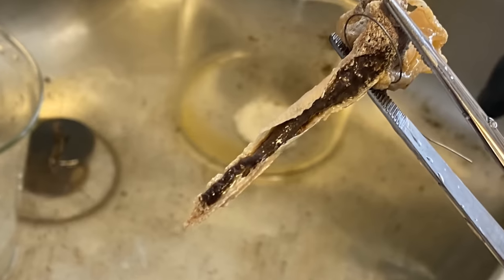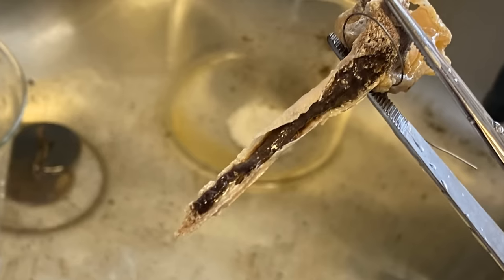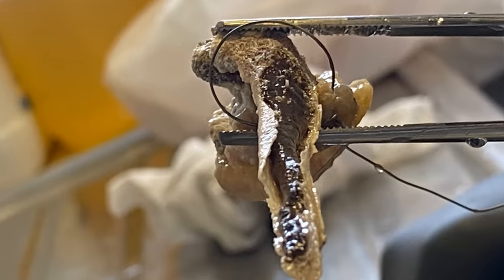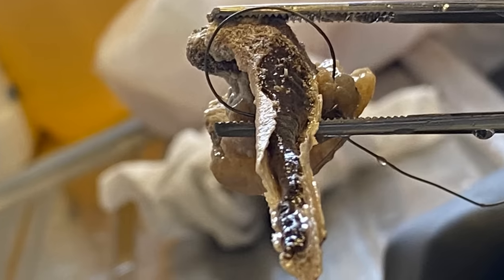And the bone itself started to dissolve. Piranha Solution had behaved almost like a saw — it cut off everything that was submerged. So through the bone, you got a cross-section. You could see the marrow inside. And even the marrow had gone black, presumably because of being attacked by the solution.